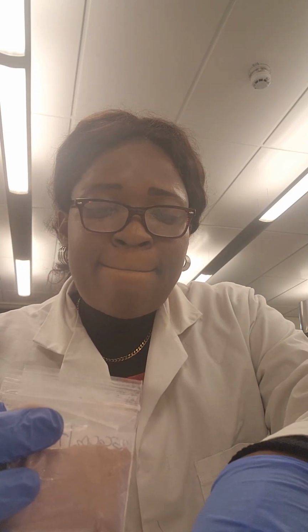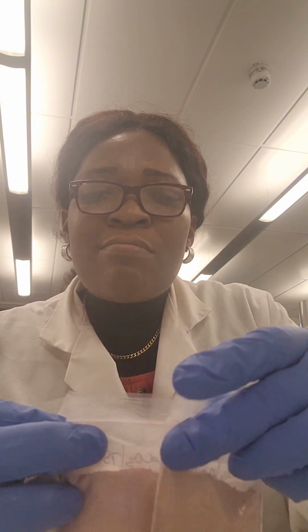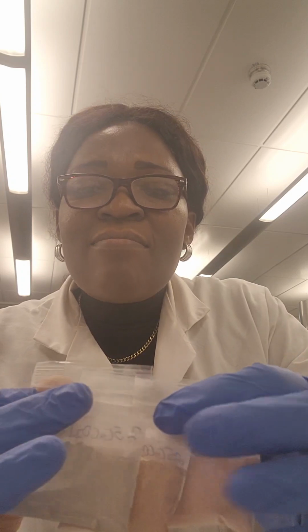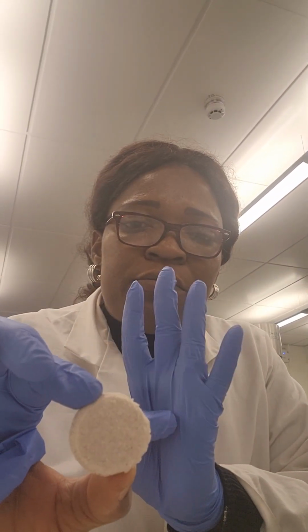So at this point, this network forms the basic glass matrix, and you see the three colors. Let me rearrange them for you to make good comparison. You see 700, 800, and 900 being the brightest. And of course, at this point, bubble formation could continue, and CO2 will continue to leave the crucible.